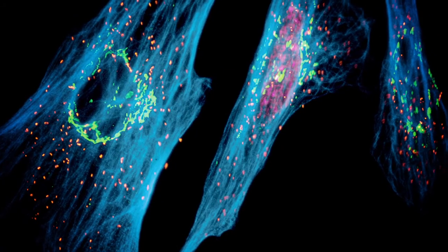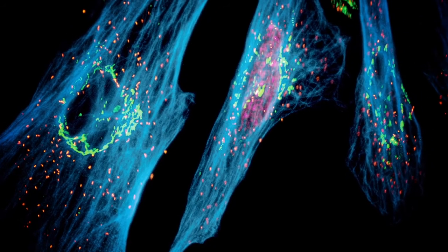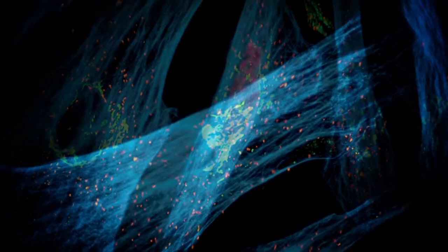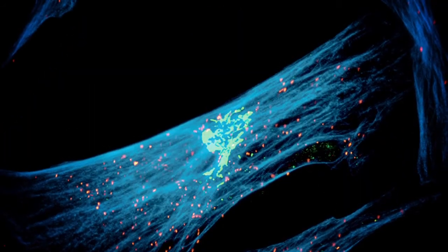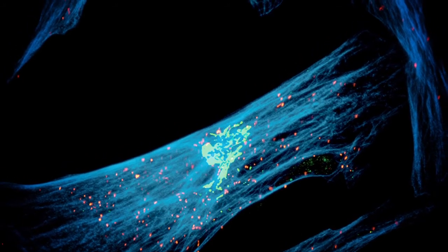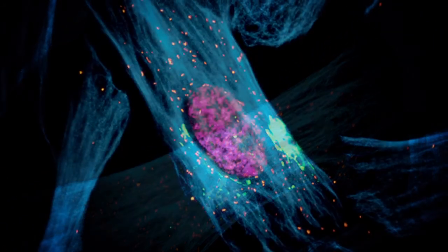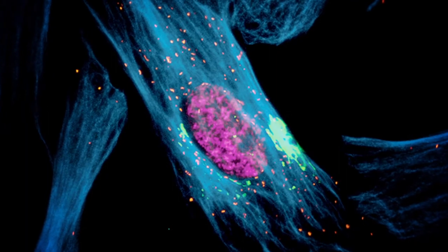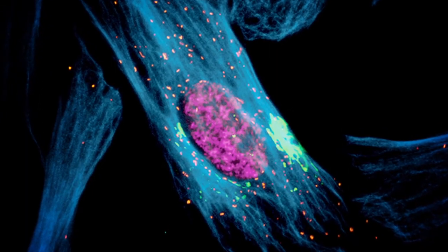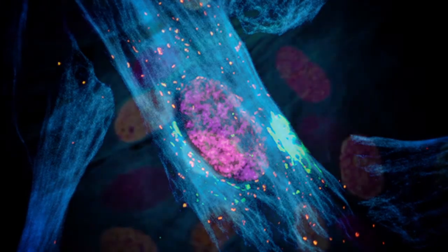Cell proliferation analyses detect changes in cell growth and are often used in drug development to measure compound toxicity or anti-tumor activity. Measurements can be made by monitoring changes in metabolic activity, cellular division, or DNA synthesis.